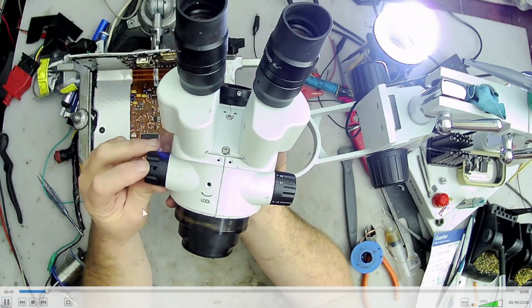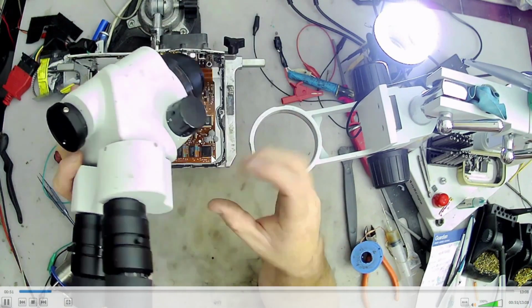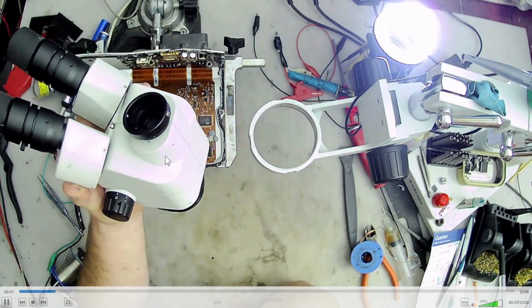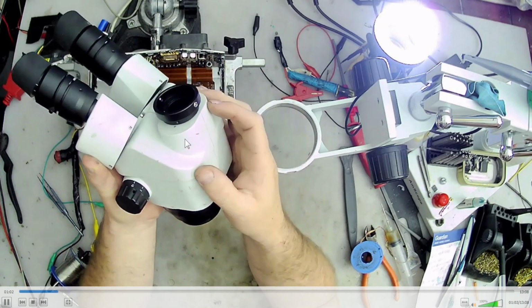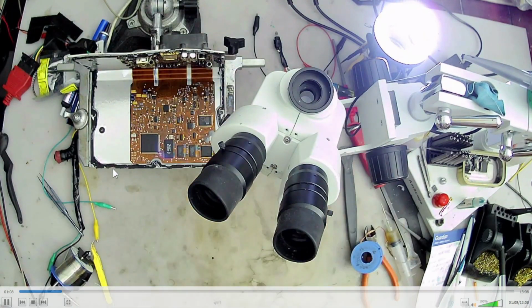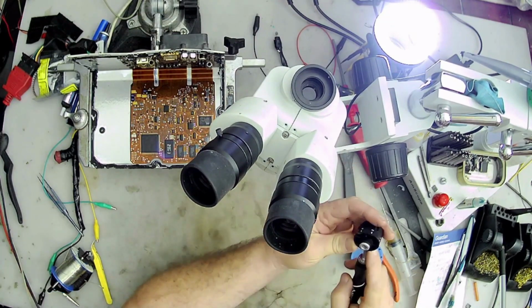And then for the magnification knobs there, they've got two Allen screws for each one. And the camera port, I can't remember what I was talking about here, so all right, we'll just keep watching. Probably rambling about something. But anyway, so I'm gonna start taking the knobs off there.